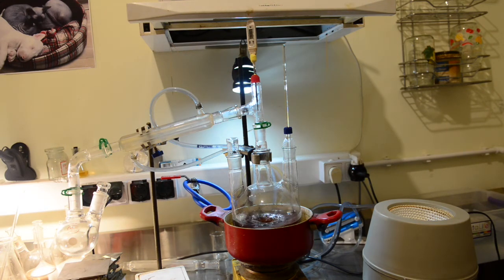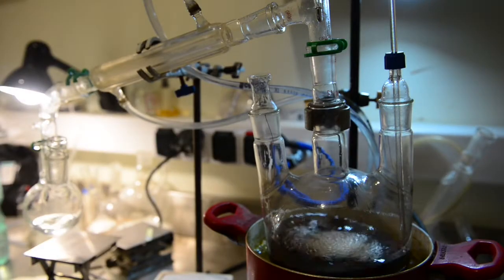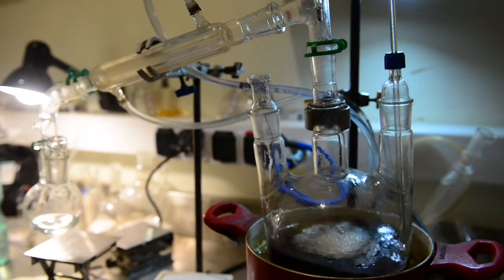We haven't used a separatory column because it is very difficult to achieve good separation of allyl alcohol and water this way. And I have not got a good enough separatory column.